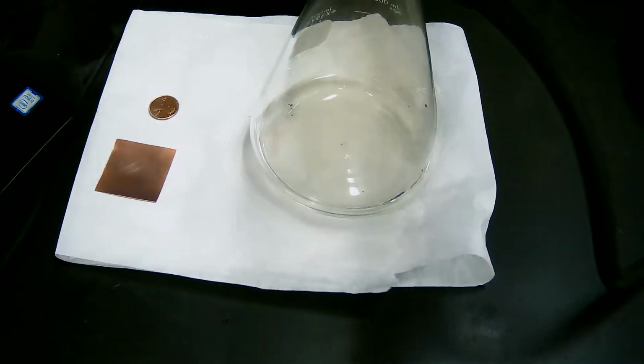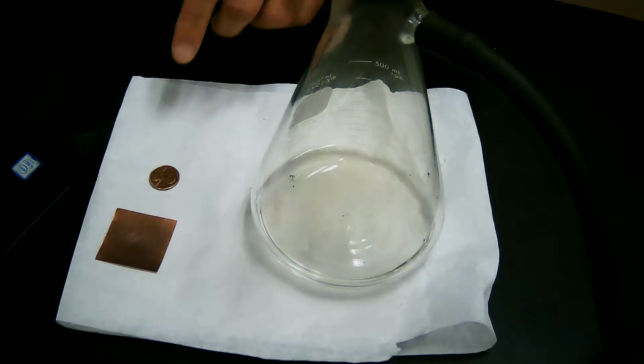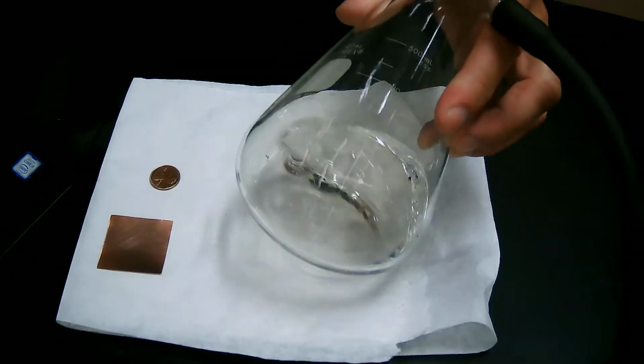This demo is taken from an experience he had while he was examining textbooks for use in the courses that were going to be in the College of Arts and Sciences. So let's jump into the demo. So as you can see, we've got a penny, we've got a copper plate, and we've got some nitric acid.